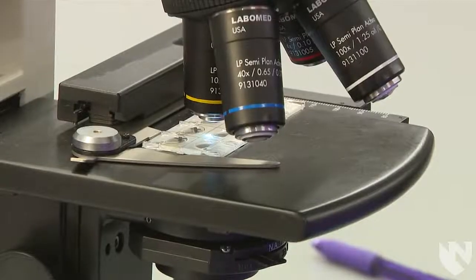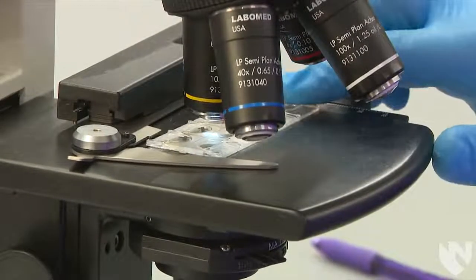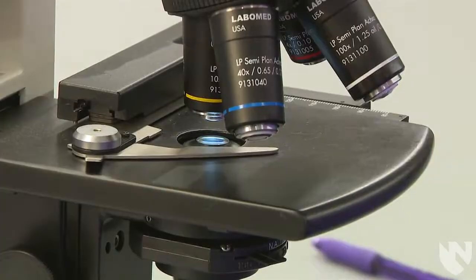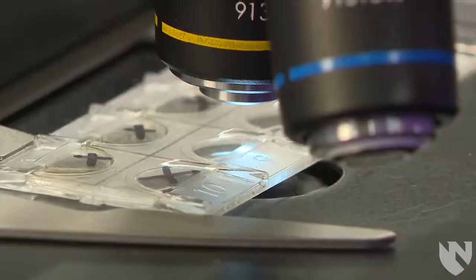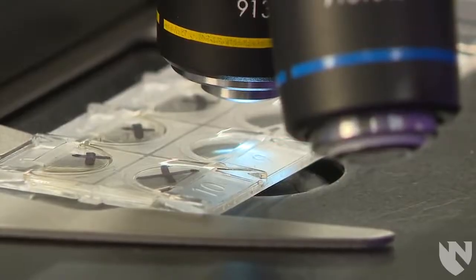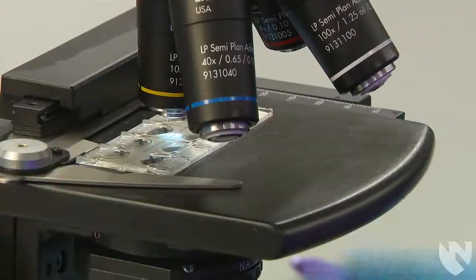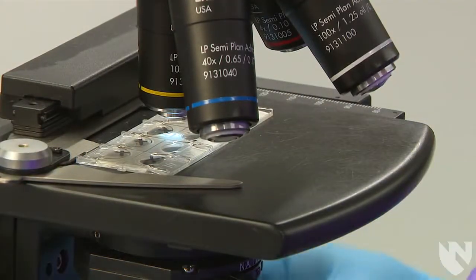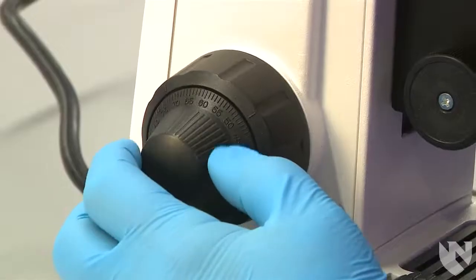If you are performing multiple urine microscopics in a row, as long as you keep your microscope in focus and use the same method, you should not need to move the stage at all between samples. Just move the objective out of the way, load the next sample, and use your fine focus as needed.